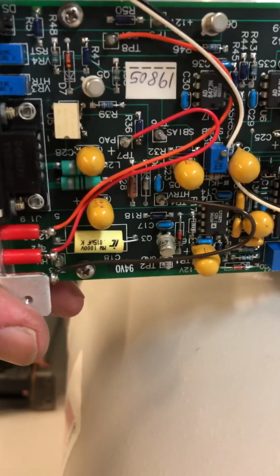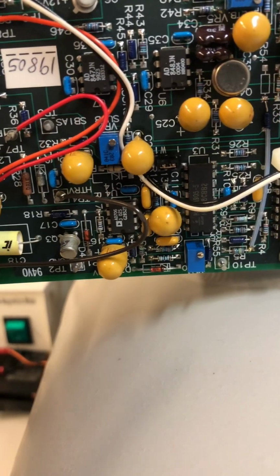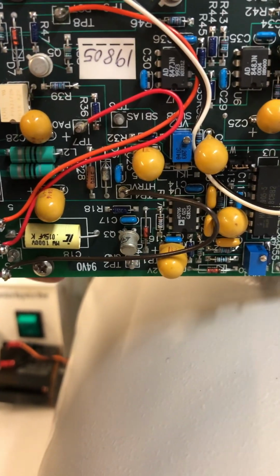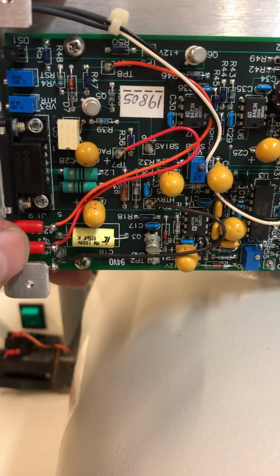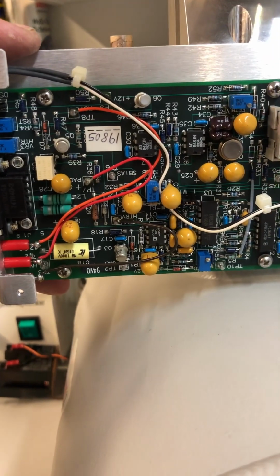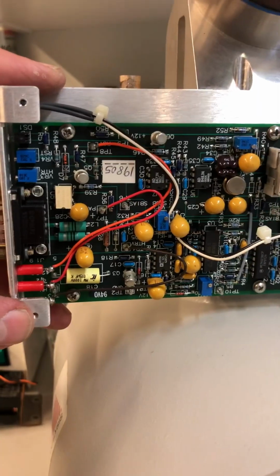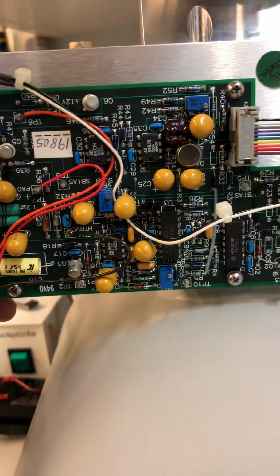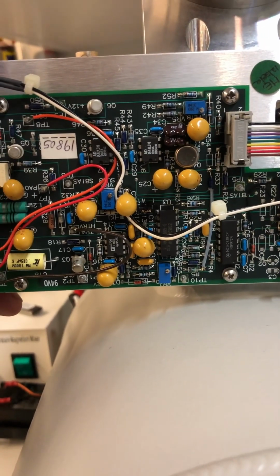The power is supplied through two lines with inductors, and here is an optical isolator. Yeah, so it probably produces both analog voltages and a digital trigger voltage signal pulse. I don't see specific sample and hold circuits. There are only 3 operational amplifiers.